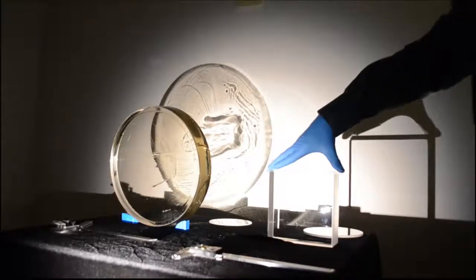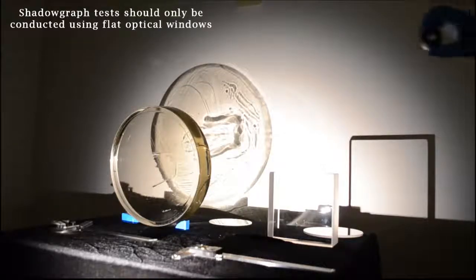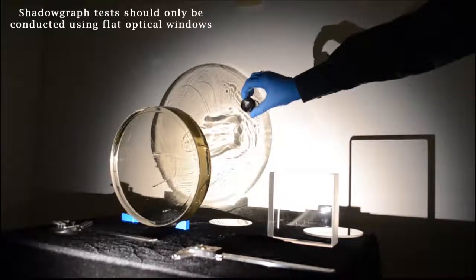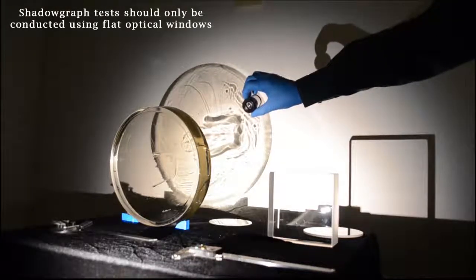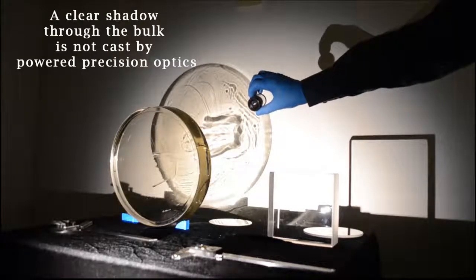It's also important to note that when you're doing the shadowgraph test, it is imperative to test flat optical windows. If you wanted to test a lens, if you look at a single element lens, you'd notice that it's very difficult to get a shadowgraph through the lens because the lens is actually focusing and expanding the light.